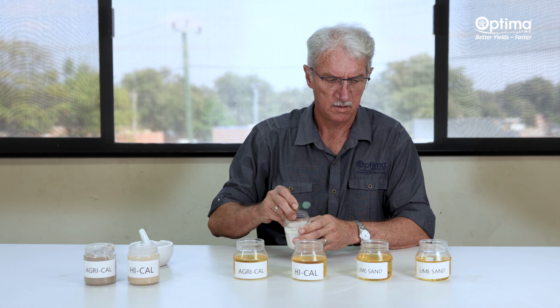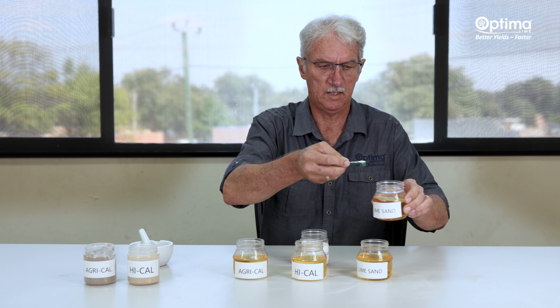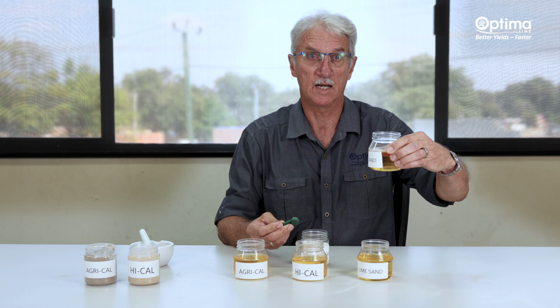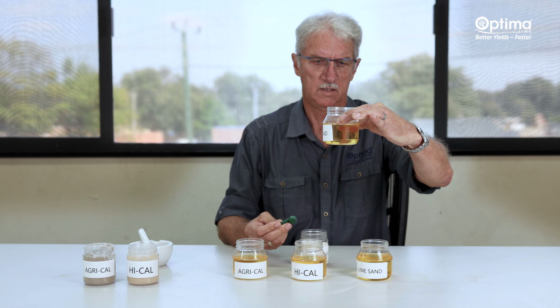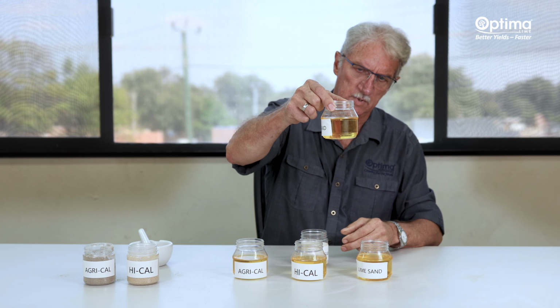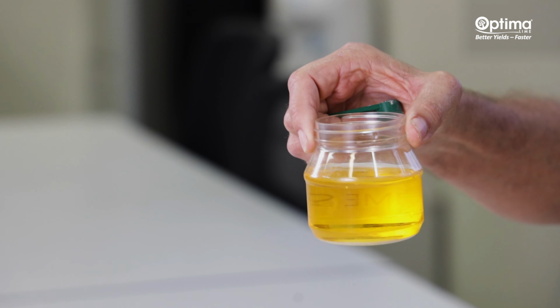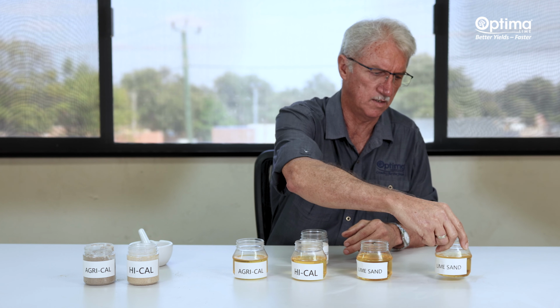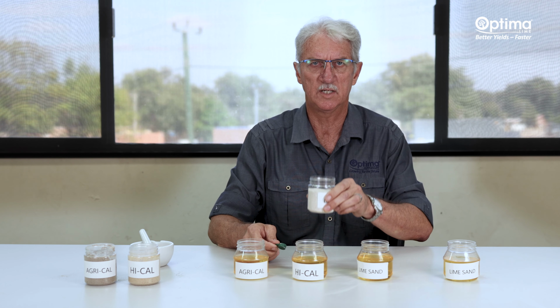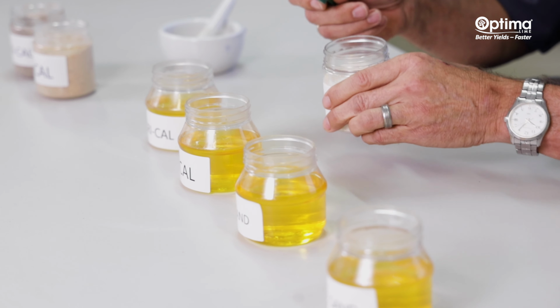Lime sand applied at 1 gram into the reactivity liquid is really not very reactive, as you can see. Not a lot happening there. It's really not showing much reactivity. The fineness is probably our biggest limiting factor here. When you look at the high neutralizing values in lime sand, however, you are questioning what is happening here. Well, let me show you.